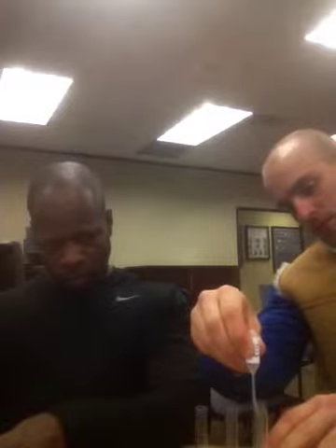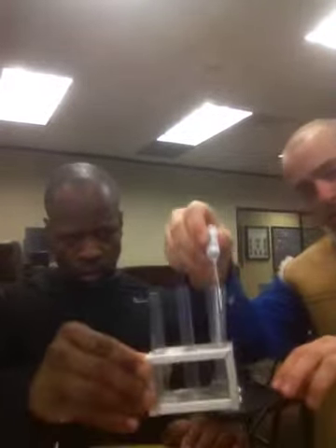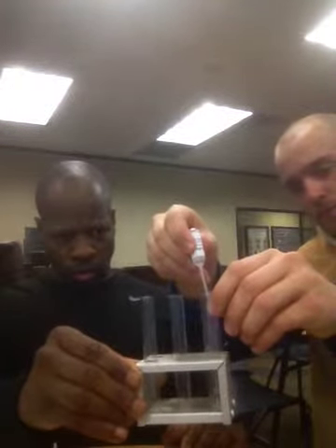We're going to start out by taking our buffer solutions. Each buffer solution is a different pH. We're going to take and add one to each test tube. This is 3.5 — we're going to fill the test tube to the 1 centimeter mark, which is most of the buffer solution. Then we have our 5.0 buffer solution. And then 8.6 in test tube 3. And 11.5 in test tube 4.